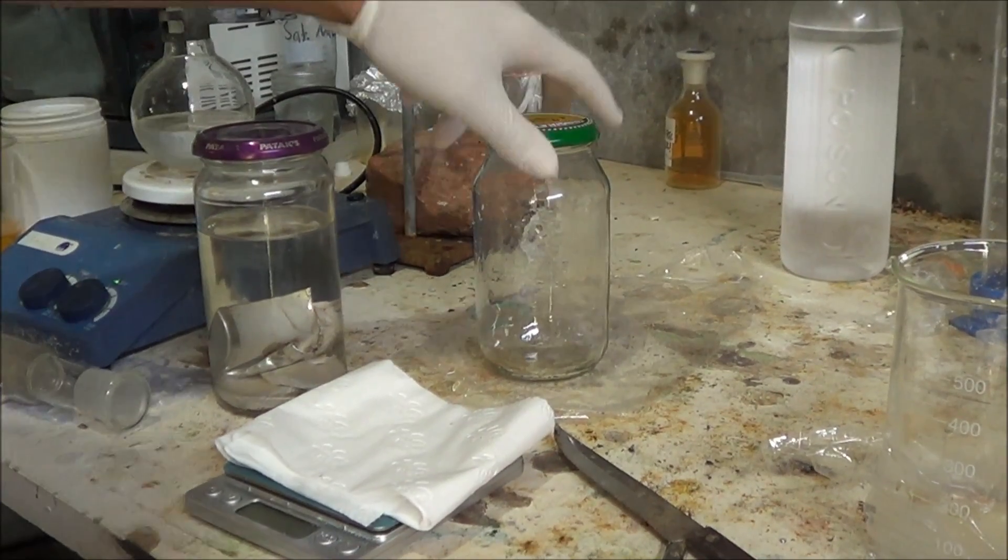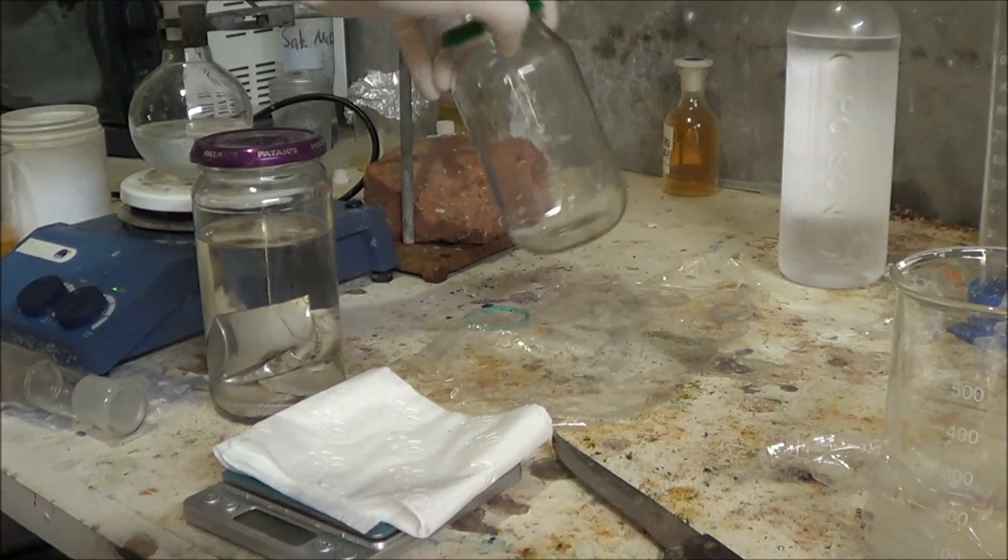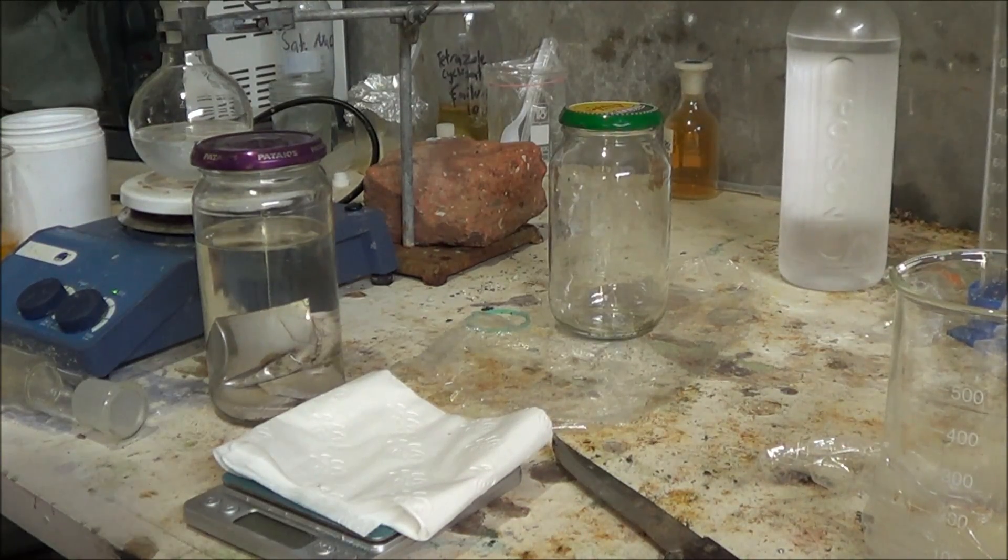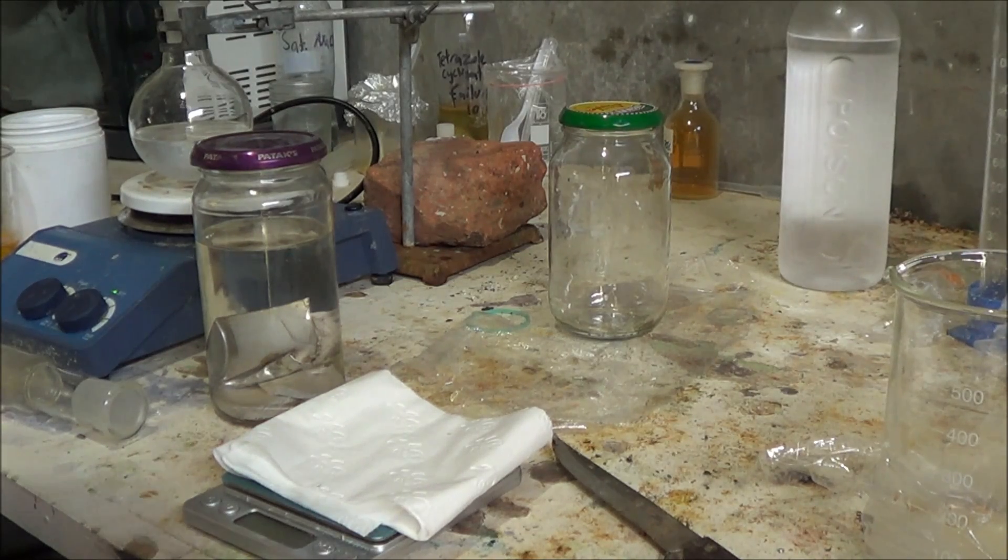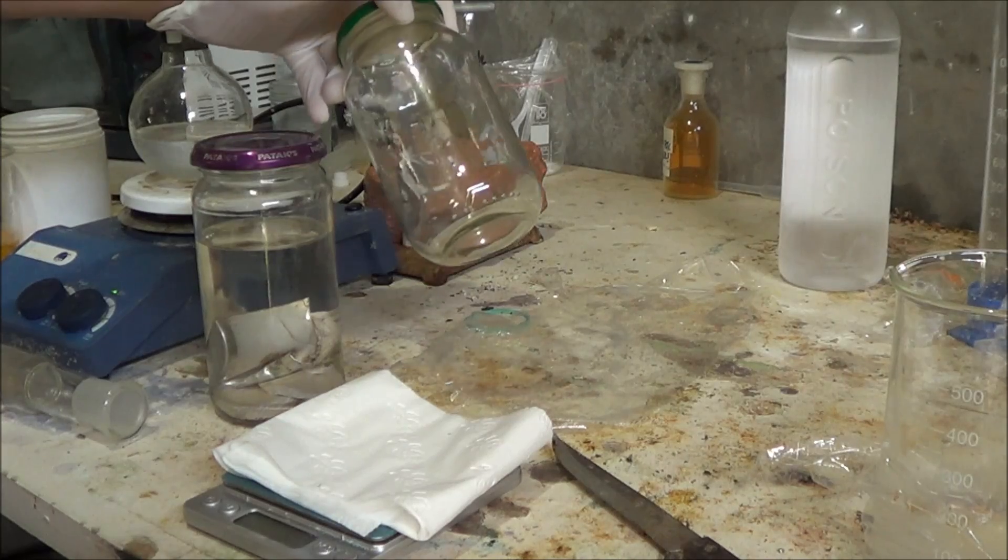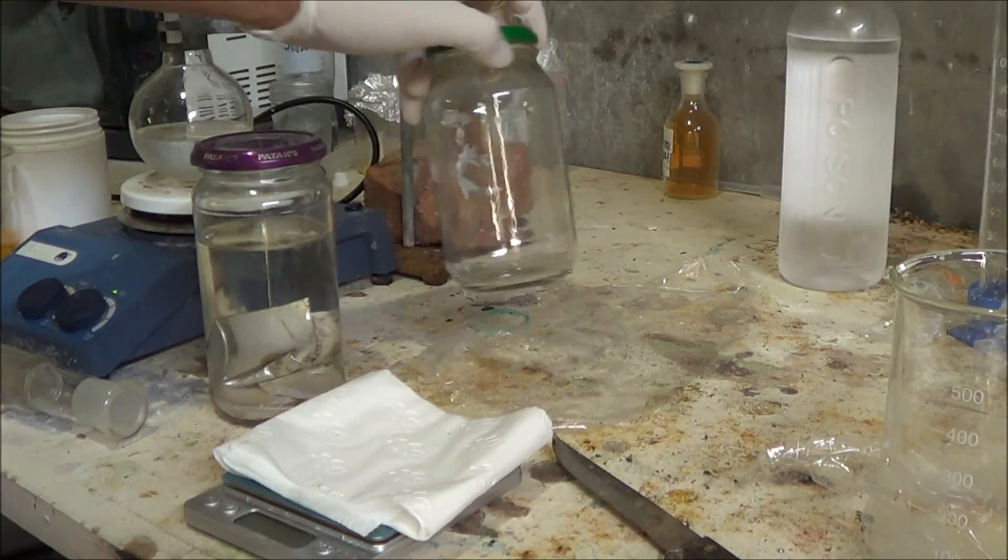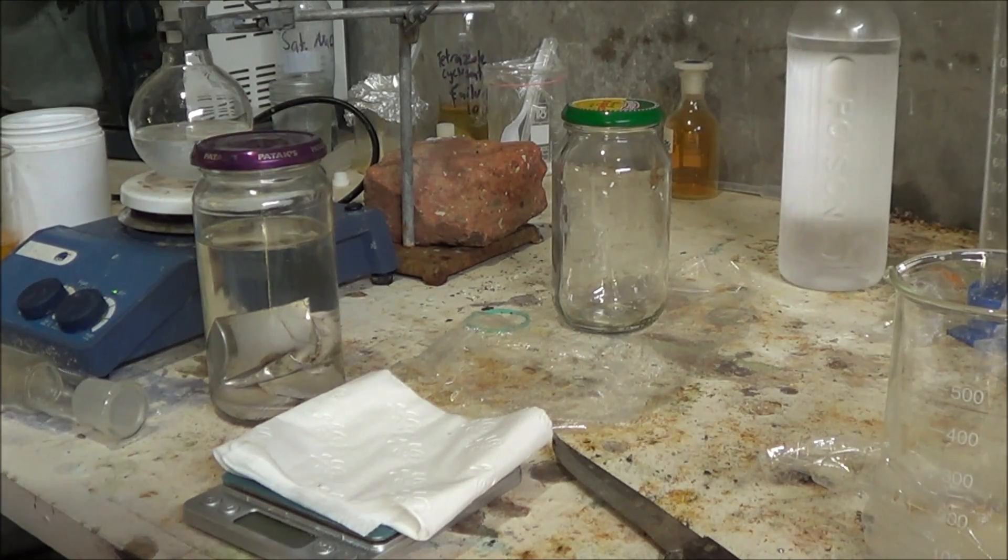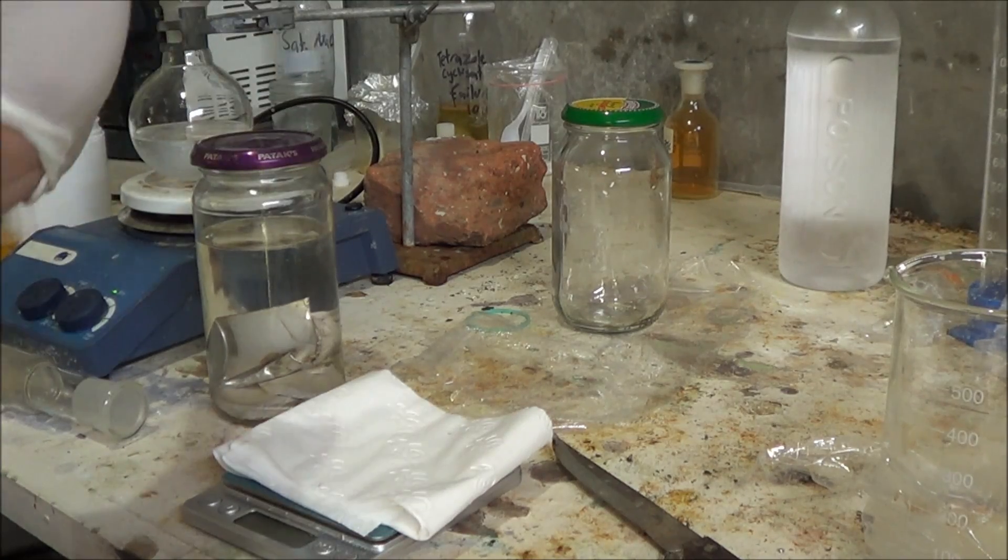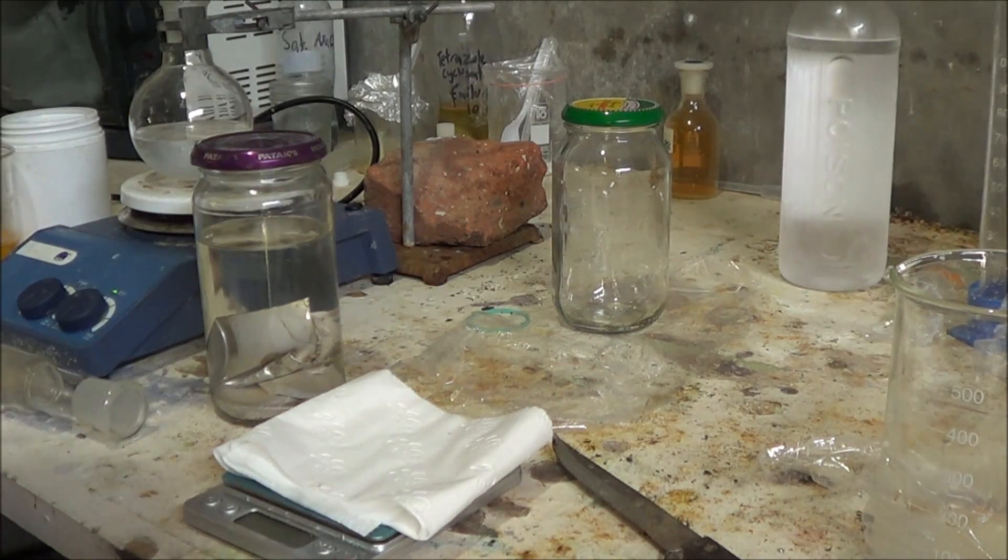So I did say I would conduct a reaction in this glass jar, and I've got to say that's one of my worst ideas I've had in a little while. Because obviously it's going to be violent, so it's going to boil off the ethanol. And we're just doing the jar, it's going to boil off and that will stuff up the reaction. I've just got a bit carried away because I wanted to use my face shield, but I'm sure there will be plenty of times in the future where I can wear that face shield.